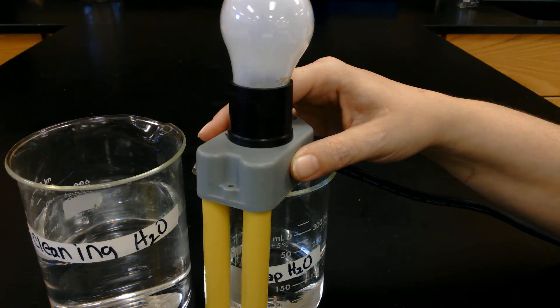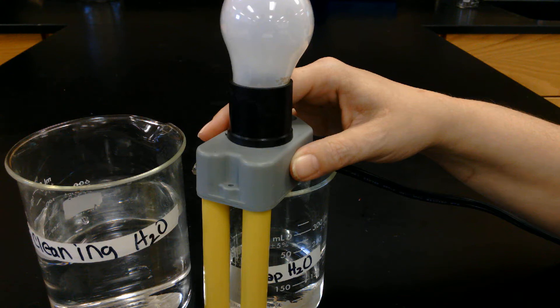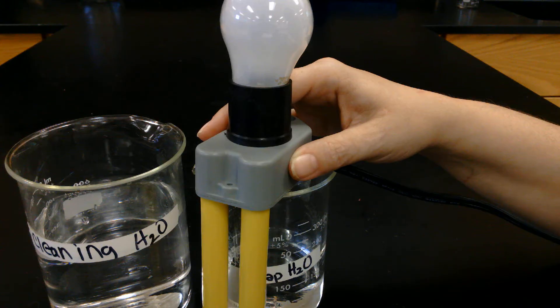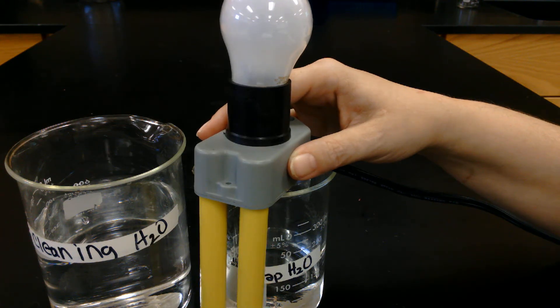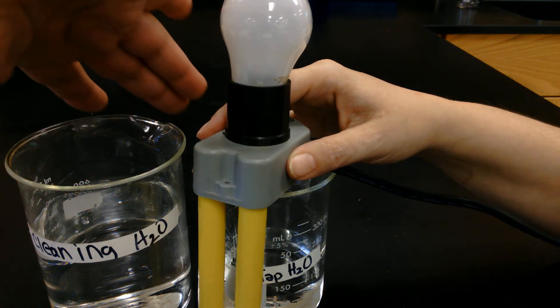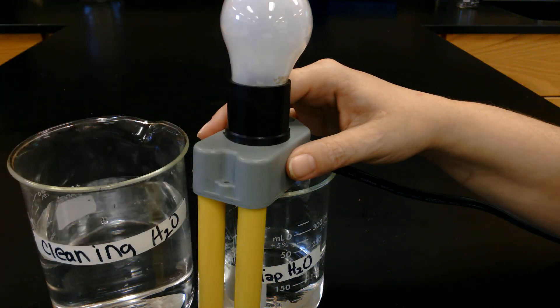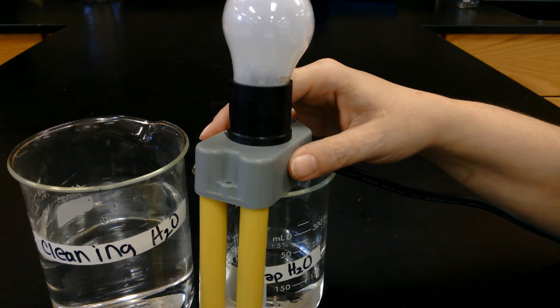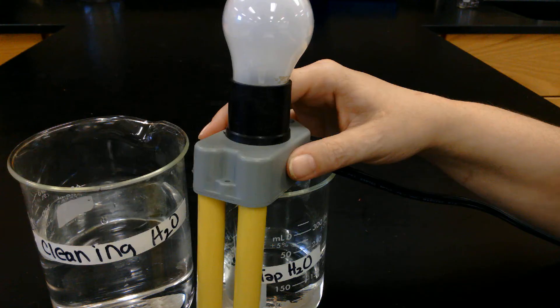Then you're going to say it's a strong electrolyte, weak electrolyte, or a non-electrolyte on your second choice, based on how bright or how dim the light is when we put it in different solutions. In between each solution, it's important to clean off our little yellow conductors — put it in this beaker. You're going to assume that after each solution, we're going to dip it in the cleaner and clean it.